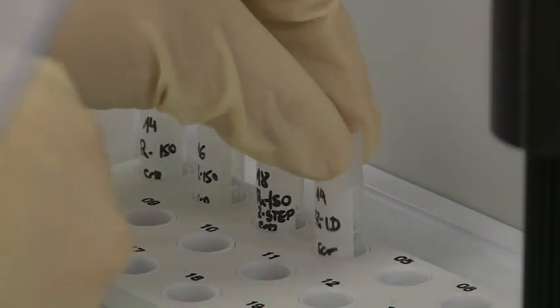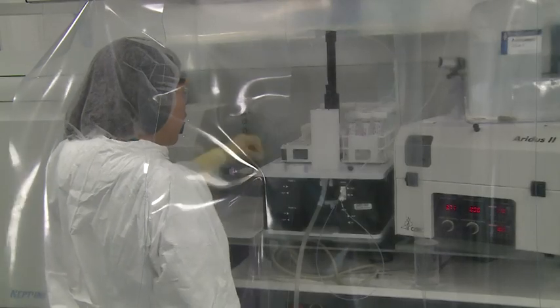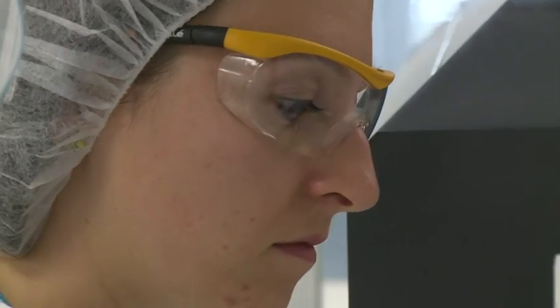We analyze for the uranium and plutonium contents in the samples, but also look at the isotopic composition of the two elements, uranium and plutonium. Once we have produced our analytical results in the clean laboratory, we take those results and compare them with the declarations of the facility.